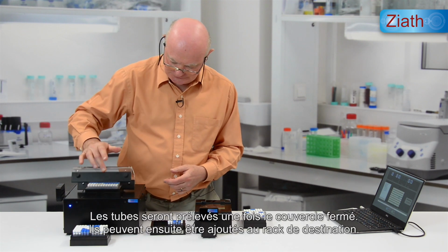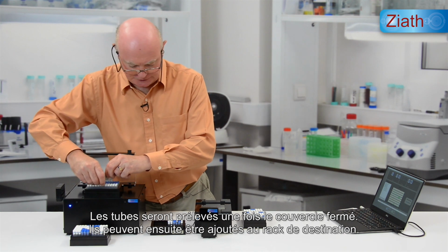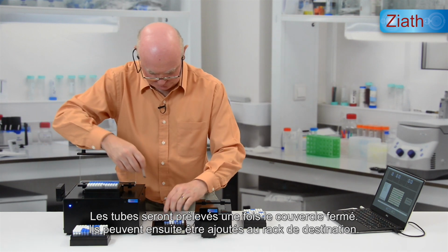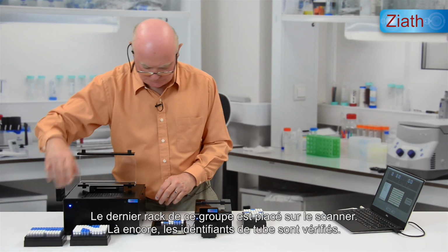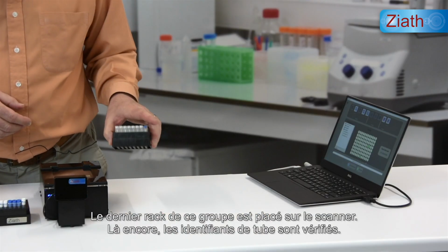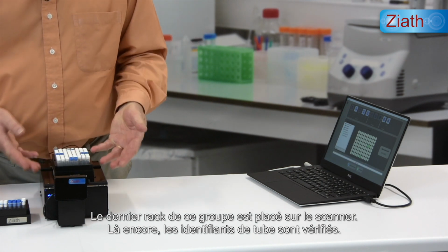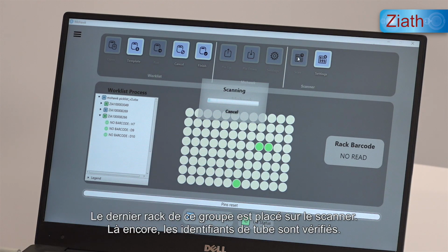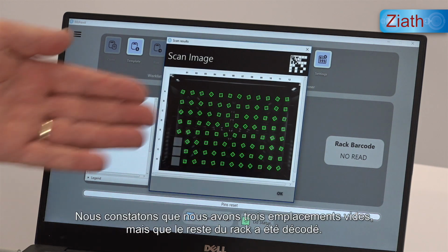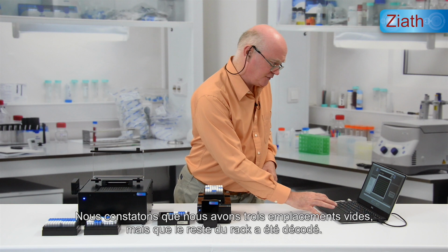When we close the lid, the tubes will be picked. We can add them to the destination rack. And move on to the final rack from this group. Placed on the scanner. Again, tube IDs are verified. We see we have 3 empty positions, but the whole of the rest of the rack has been decoded.